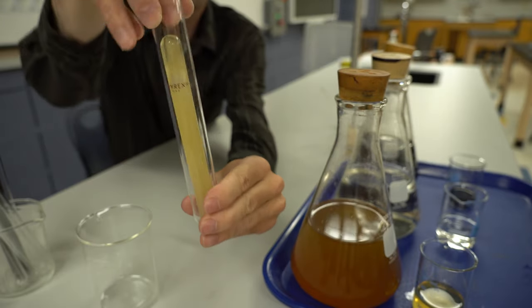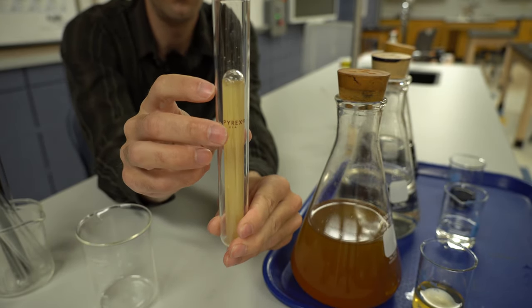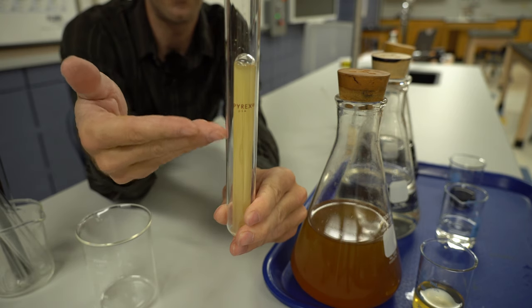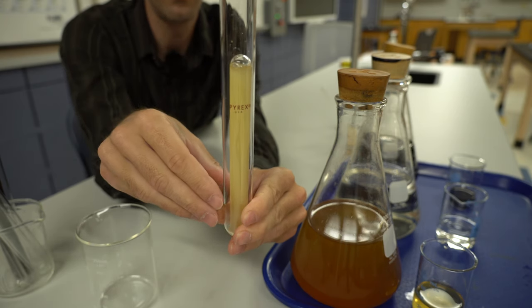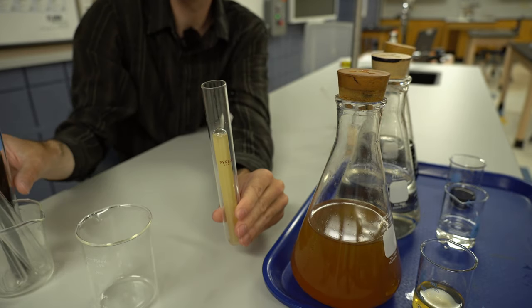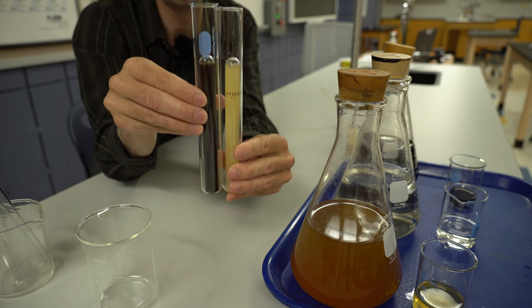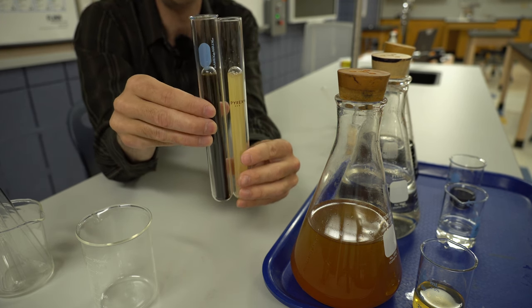And then we're just going to kind of flip this over, and then we're going to measure the air bubble that's been produced there. And over time, that yeast is going to grow, the CO2 gets captured, and we'll be able to measure that over a period of time. We're going to repeat that also with the other sugar solution. And you can see here pretty much around the same air bubble. And let's see how they look tomorrow.